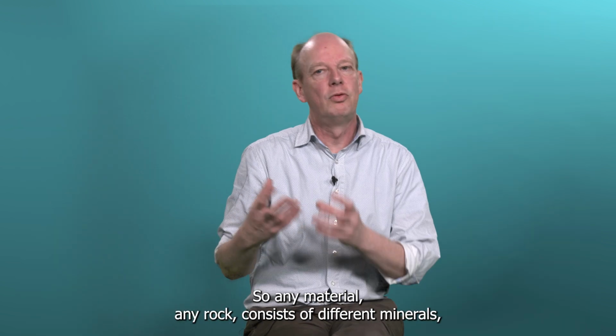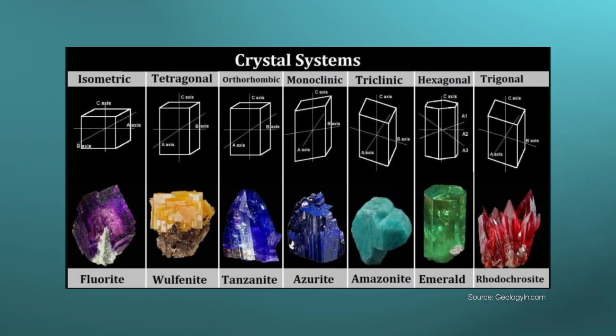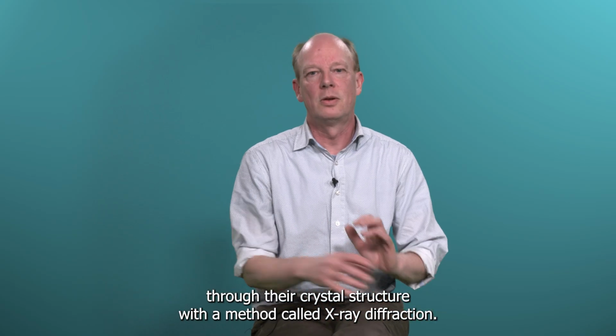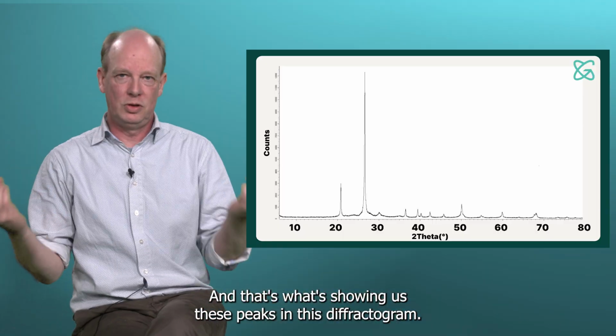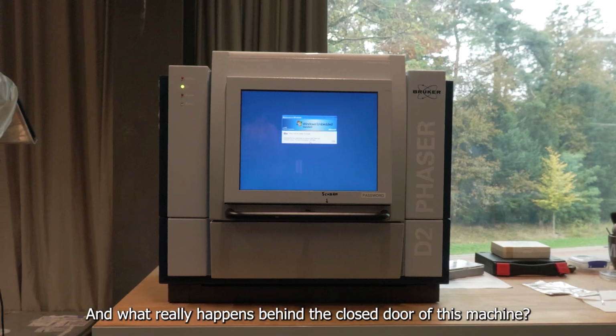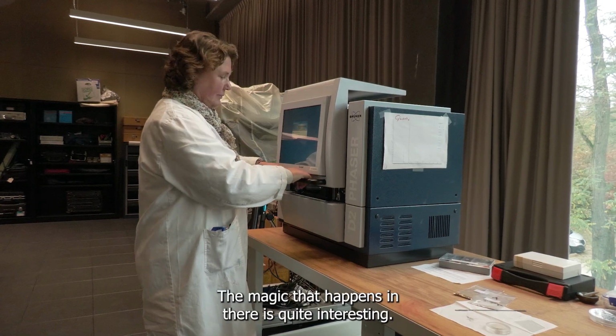So any material, any rock consists of different minerals and they all have a different crystal structure. And these minerals we can identify through that crystal structure with a method called X-ray diffraction. And that's what's showing us these peaks in this diffractogram. And what really happens behind the closed door of this machine? The magic that happens in there is quite interesting.